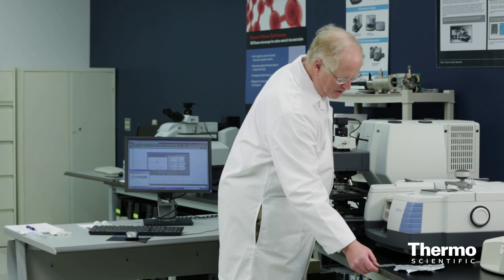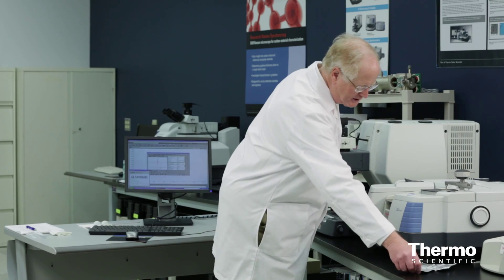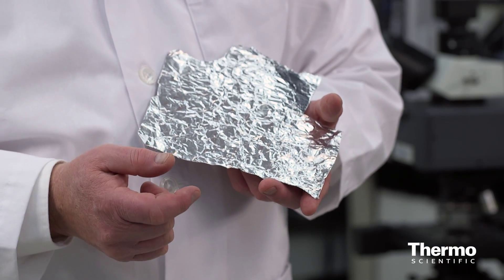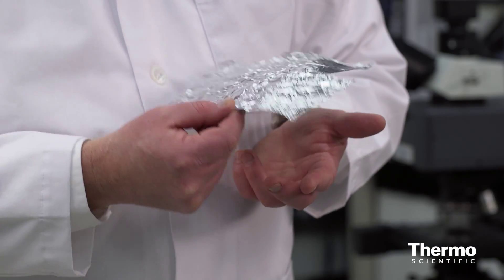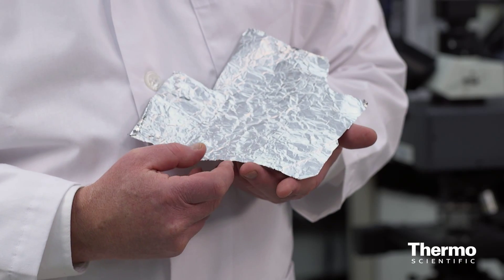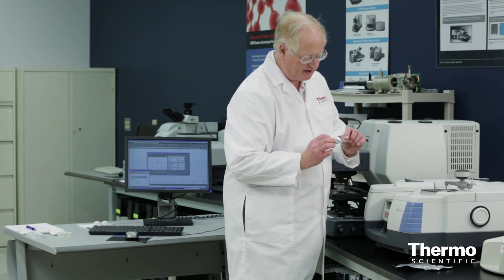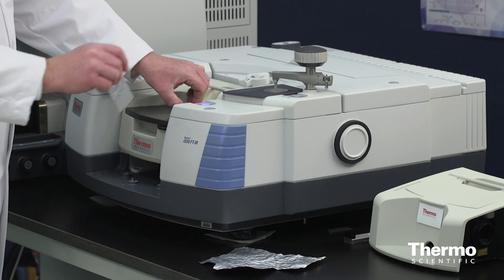For the sample, I'm going to be using this piece of aluminum foil. On this bigger piece, it's a little easier to see. You can see on one side it's very shiny. On the other side, it's kind of fogged over, and that's going to be my sample. I've got a piece here I cut out of it, where I have the shiny side and the slightly cloudy side.